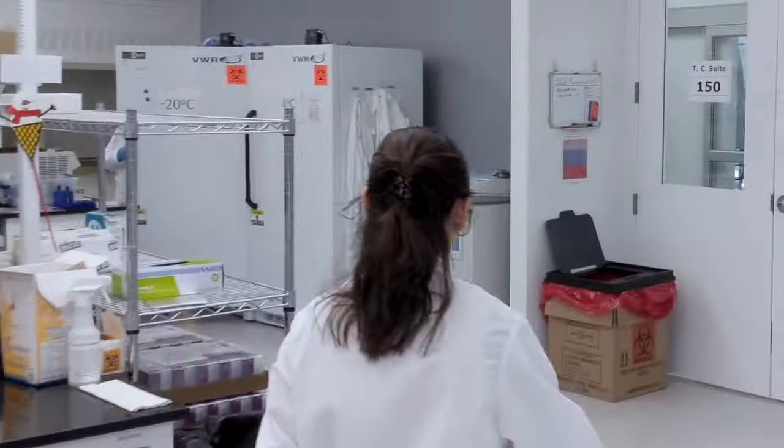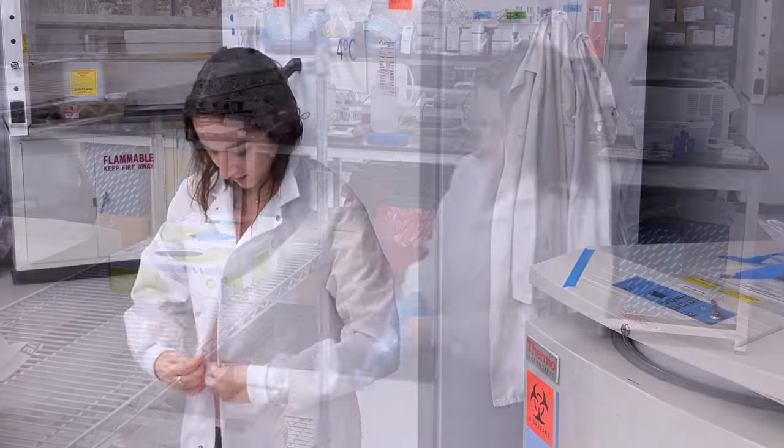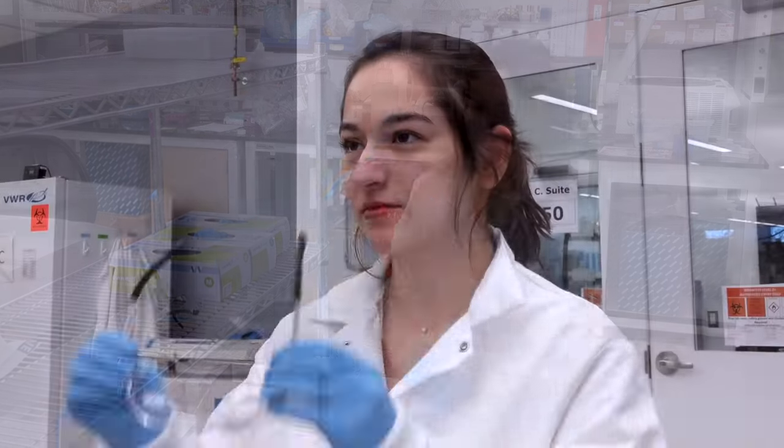Before beginning any experiment, make sure that you are wearing the appropriate personal protective equipment, including a lab coat, gloves, and if necessary, safety glasses.